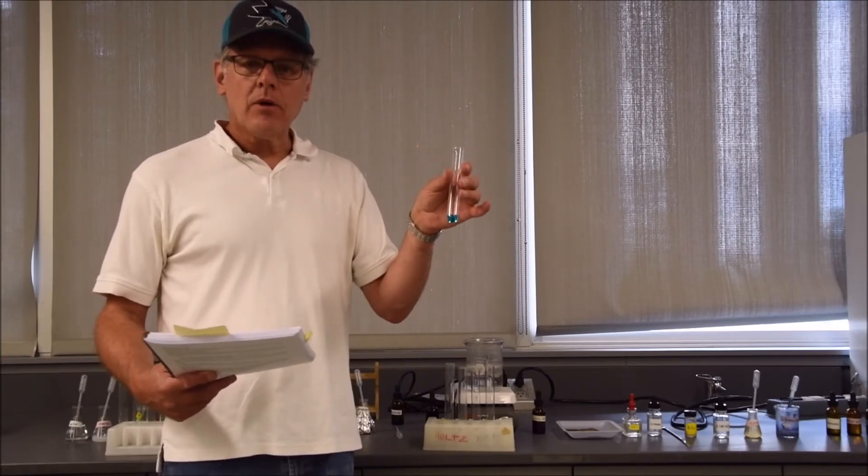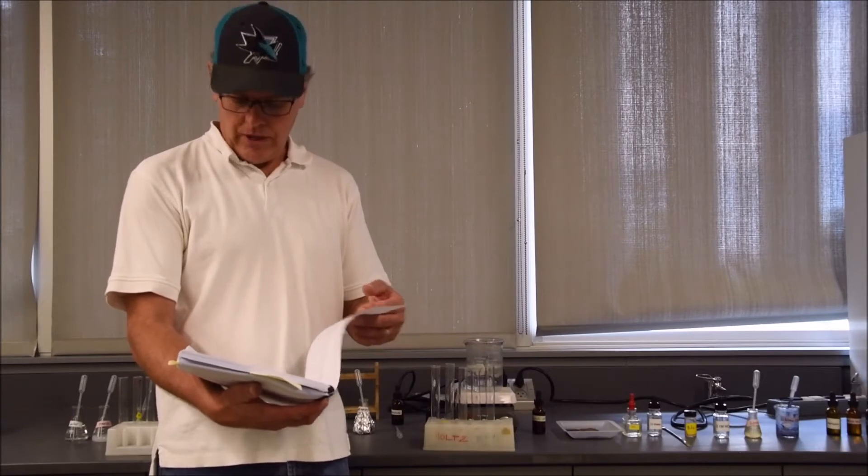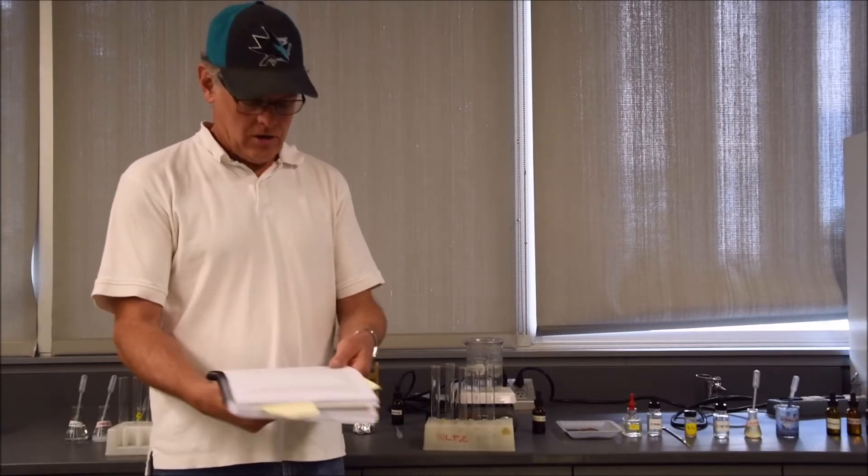The test is described on page 38. The result section is at the end of that lab on page 41. You should write down that blue color for original color on page 41 and follow along on page 38.